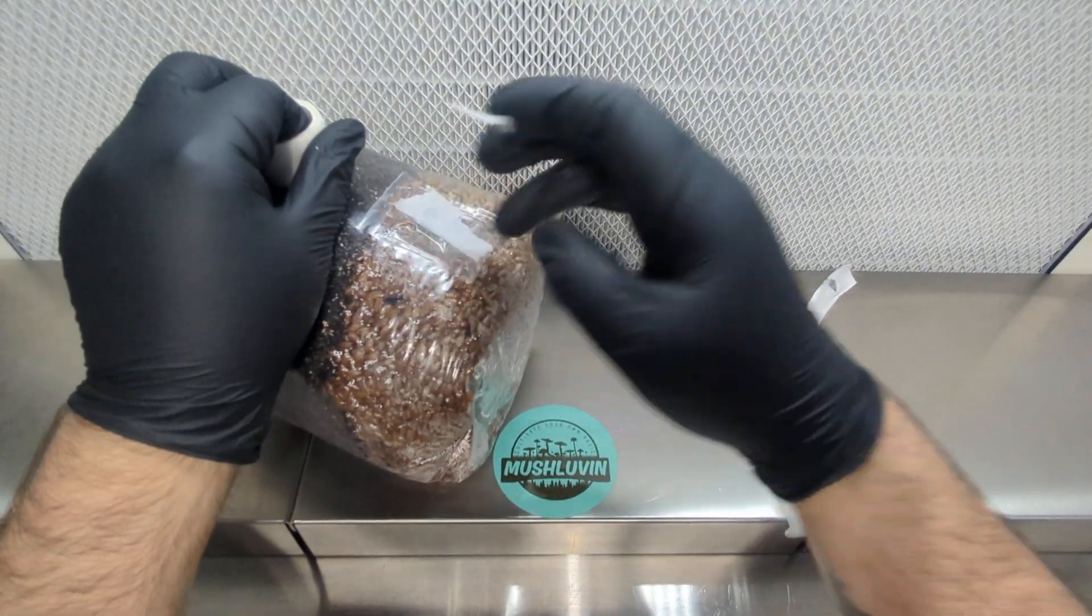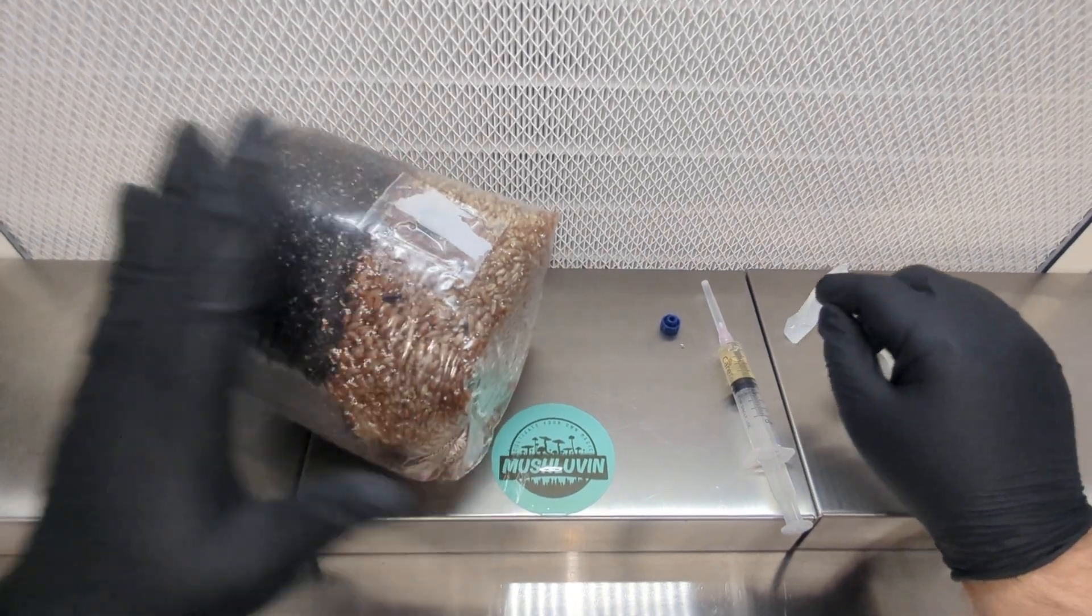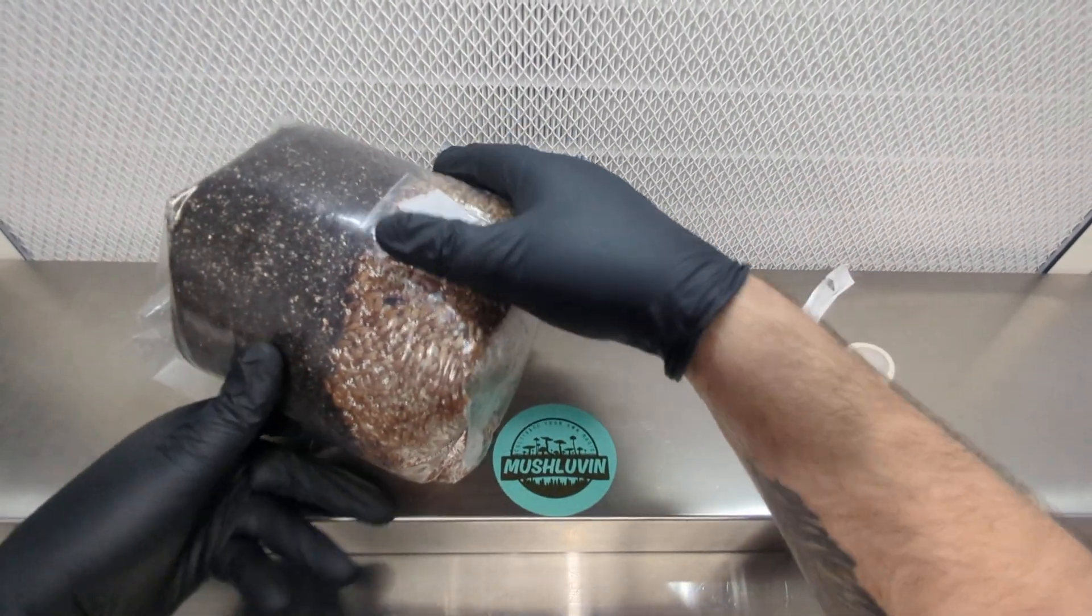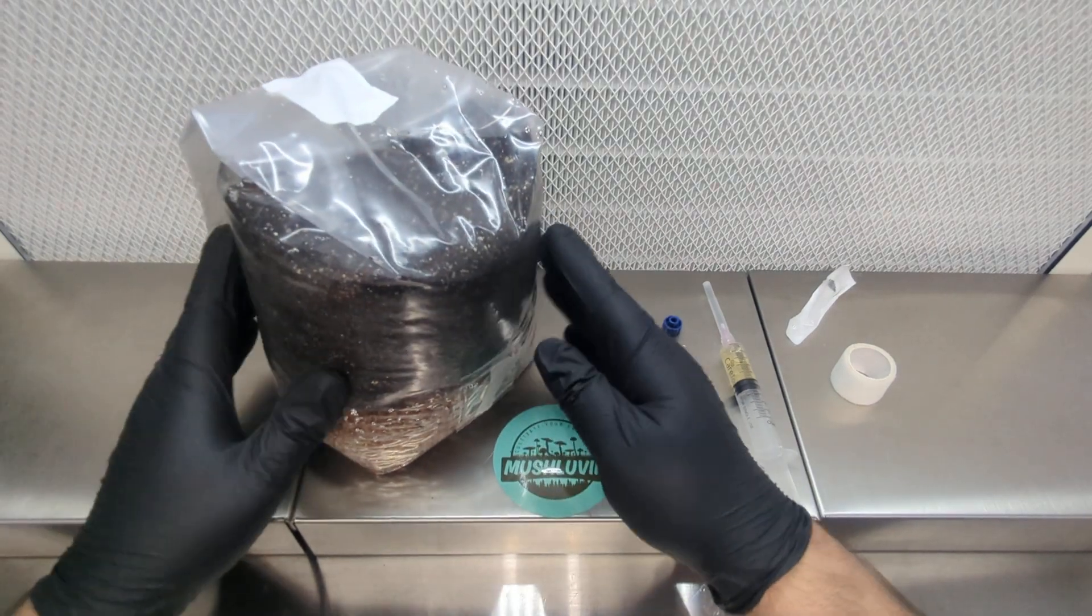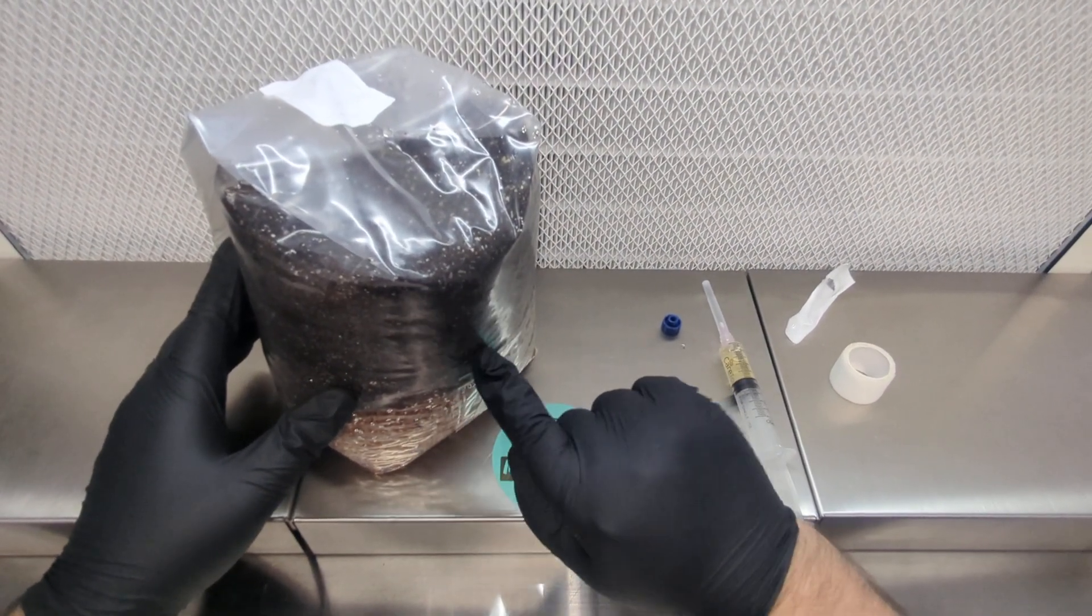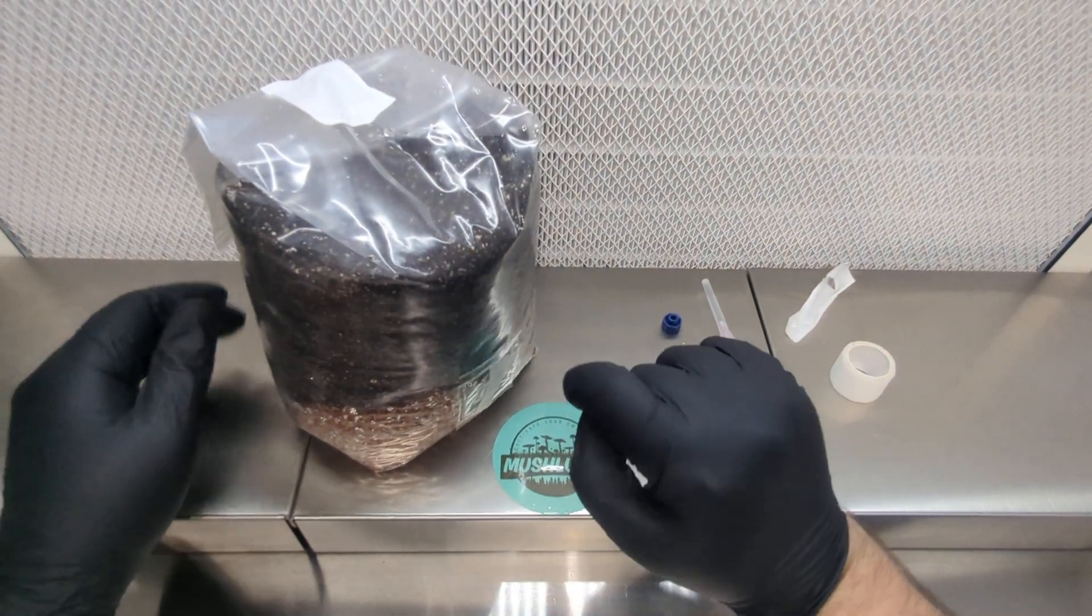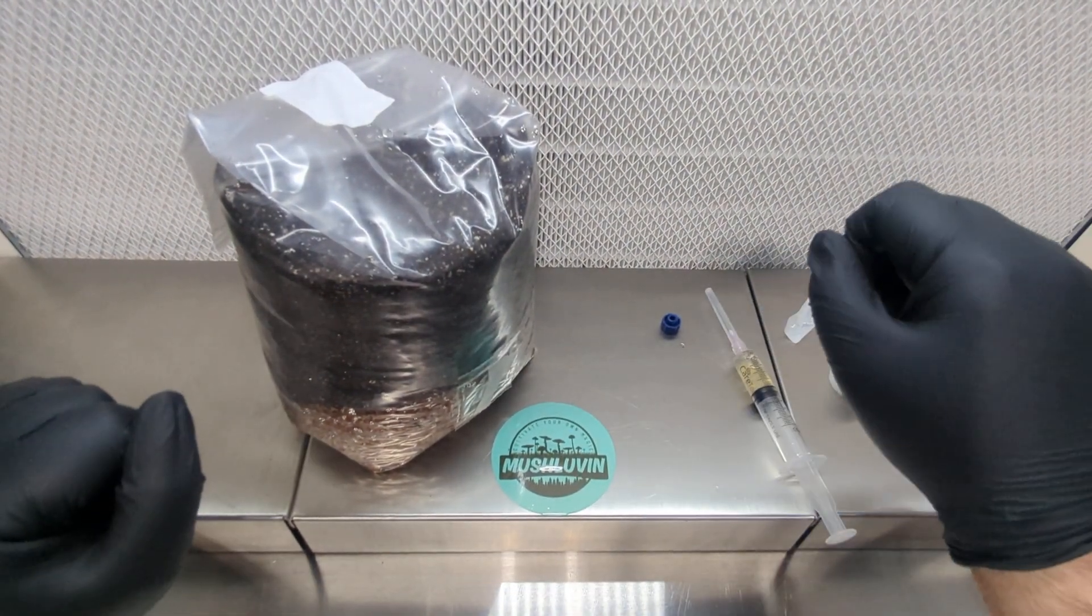The port is self-healing, but I put tape on it just to be as safe as I possibly can. So that's pretty much it. I'm going to label it with the strain that I did and the date, because if I wait two days I will definitely forget the date that I did it.